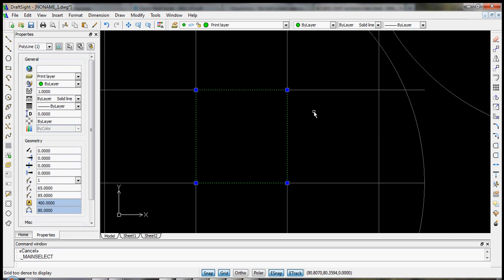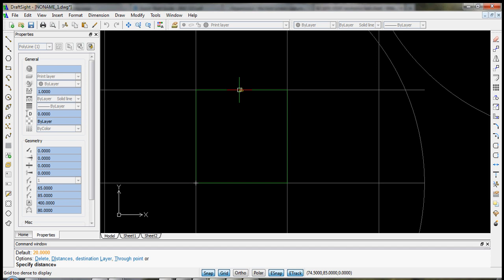Now the last thing I like to do before I go on is I like to actually have a printed border around each of my squares, which will become a single device perhaps. So let's use our offset command again.